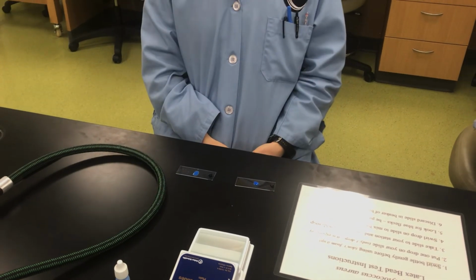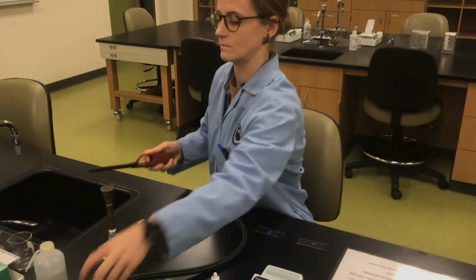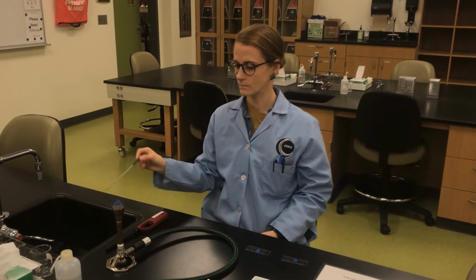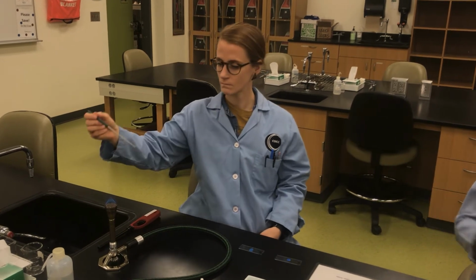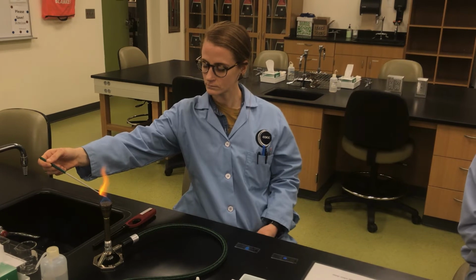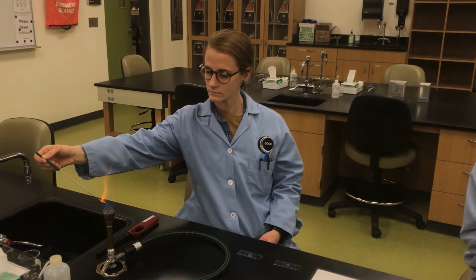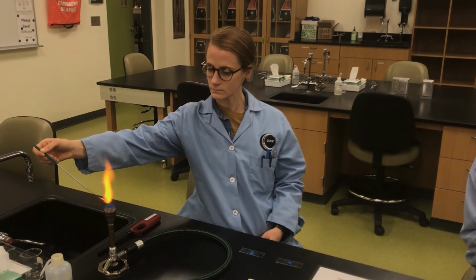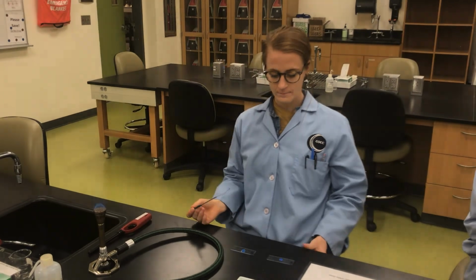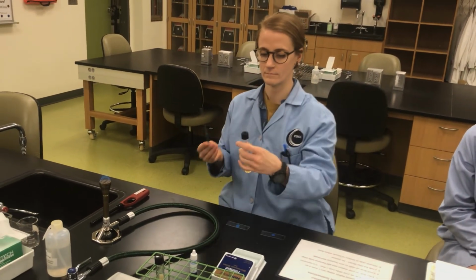Now we're going to use your loop, so go ahead and fire up the Bunsen burner. And go ahead and flame your loop, because aseptic technique and always. And what you're going to do is you're going to add a little bit of each culture, the appropriate culture, obviously, to each slide. You're going to smear a little bit of the bacteria on the glass next to the drop. So we'll start with A.